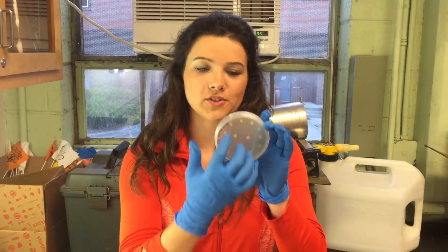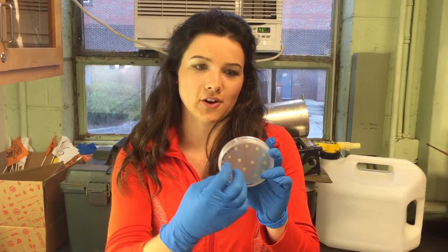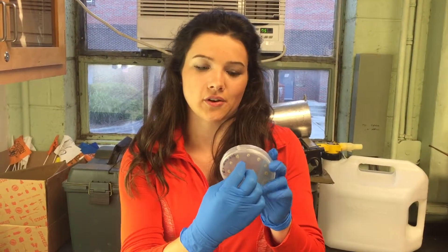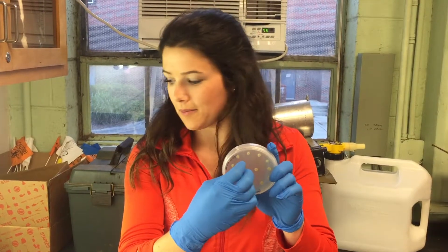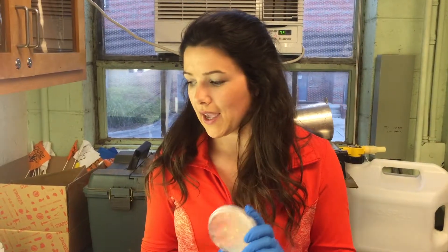With these little halos surrounding the vascular tissue, we would then take these once they've grown out enough and take the newest growth of the mycelium and re-plate those using a bore tool onto new PDA and let those grow out. And then, from there, we would do a single spore isolation to make our spore suspension. I will demonstrate how to do this next under the laminar flow hood.